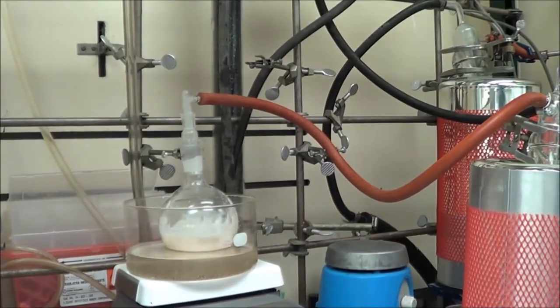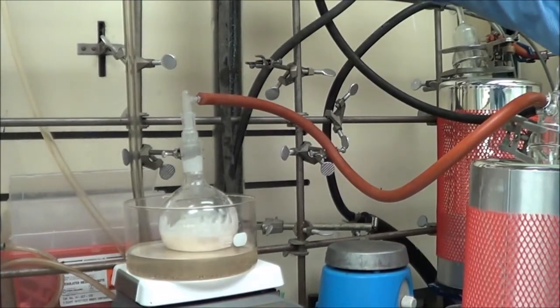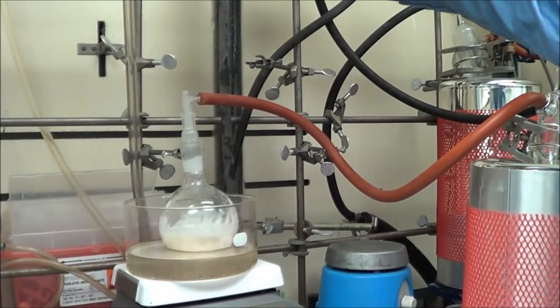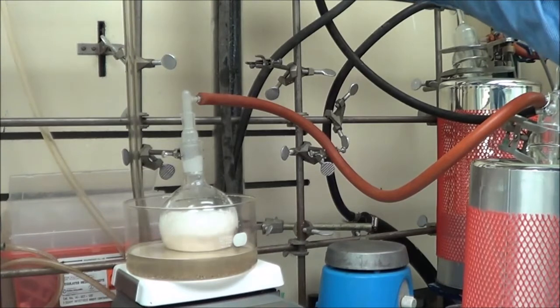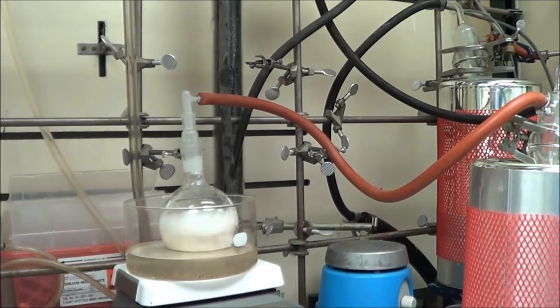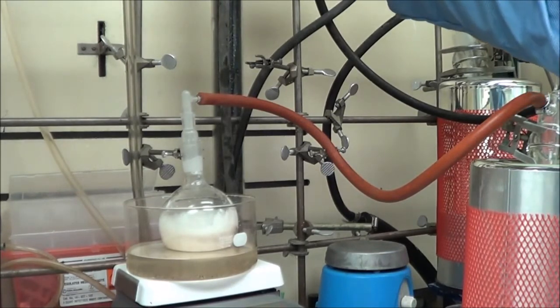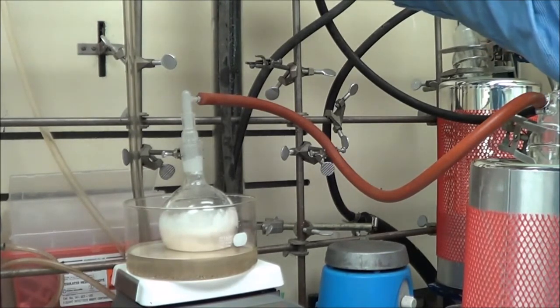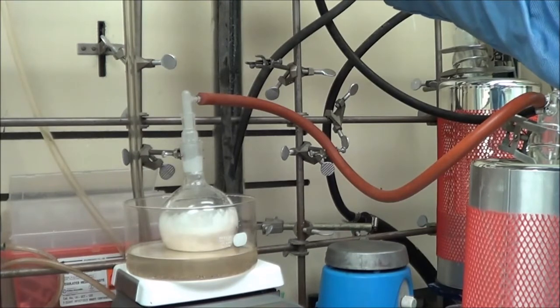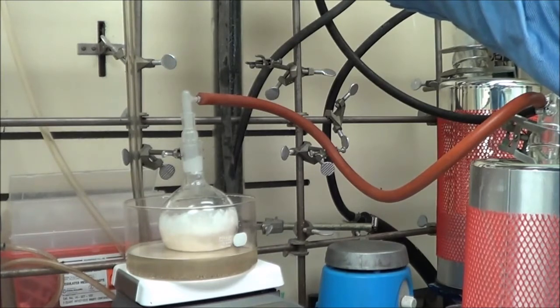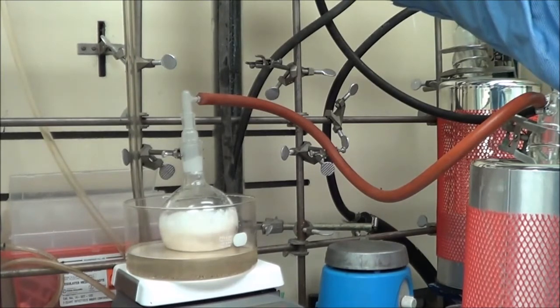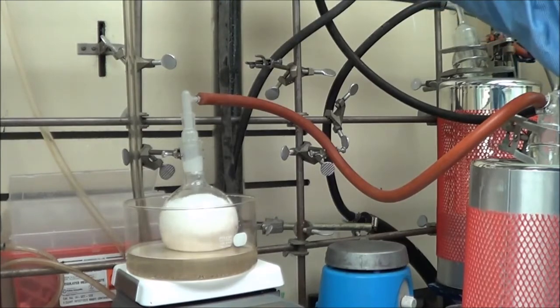We melt the material and get it into a round bottom flask and attach that to the vacuum in our Schlenk line. When you hit vacuum, you have to be really careful. Again, this stuff is soapy. And like soap, it's going to bubble up when you put it under vacuum. If you're not careful, this stuff will completely shoot down the line, losing a lot of product and giving you a lot to do in terms of cleaning. It is not easy to clean this stuff up. You see here I got a little impatient right about here. And there we go. I almost overdid it, but I caught myself just the right moment and backed up on the vacuum.